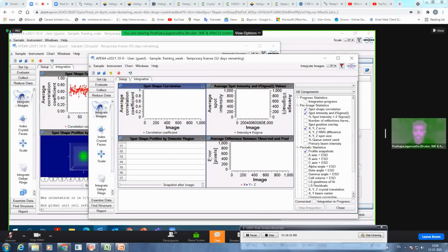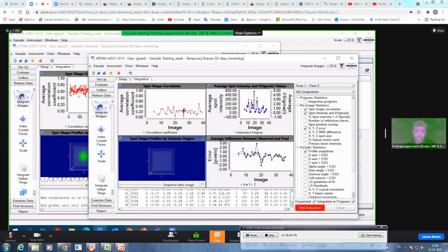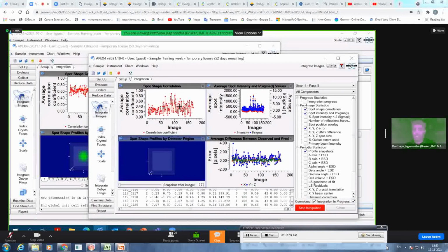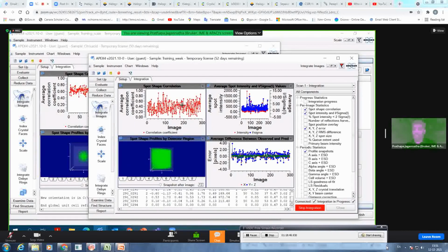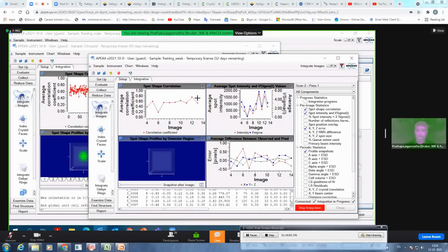I was looking at the 0 values last time. Now I can already see it's coming slightly on the greener side, and I am looking at some values now. Instead of 0, you can see it's now doing the scan, and you see almost 60, 70. You can see this up and down, because some of the frames do not have reflections. So obviously you see this up and down. In some of the frames, you get the reflection where your correlation is around 60, 70%. So you are on the right path, in the right direction. This is how you tweak the parameters of the integration to understand, or to enhance, the quality of your integration to achieve better data statistics, even for very weak data like this.